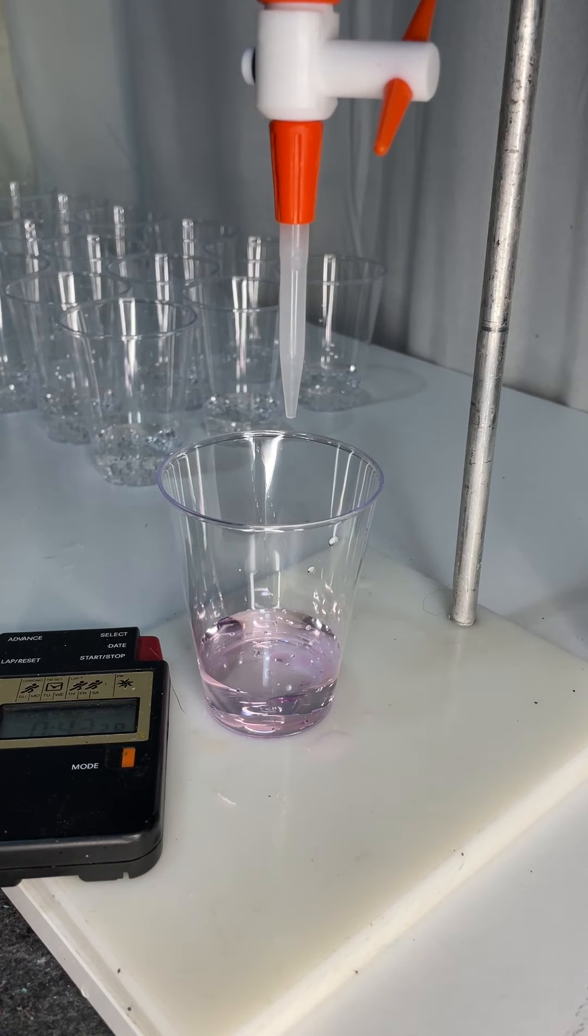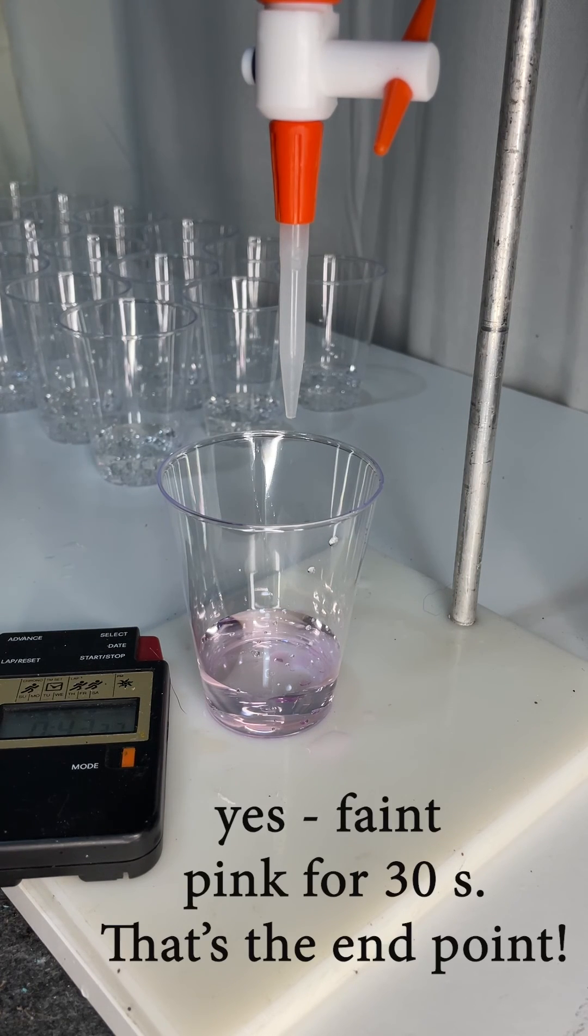It's still pink and the pink color still there. So I think that's about it. Yep, pink for 30 seconds. That's the endpoint.